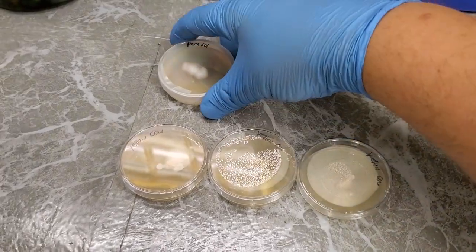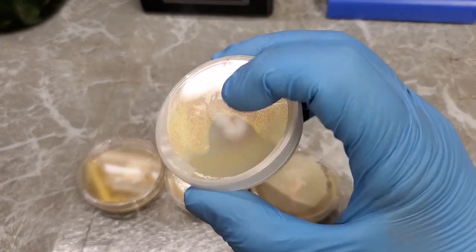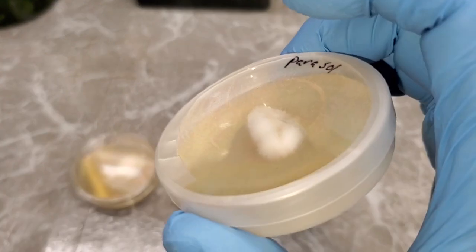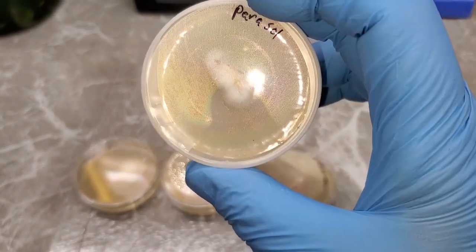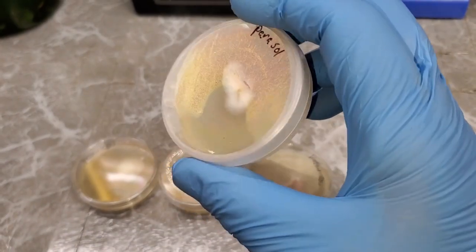And this right here is a sample. You can see it growing pretty nicely there in the middle. It's kind of fogged up on the lid, but you can still see that under there. It's growing really nicely on the agar in here, and there's absolutely no contaminations.